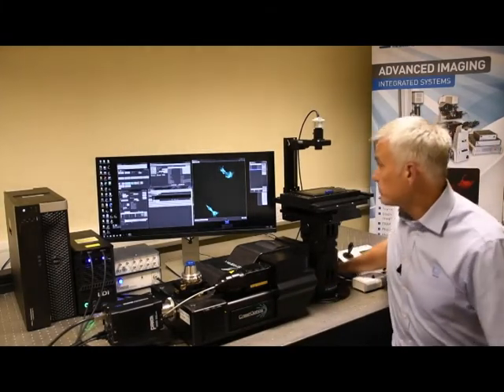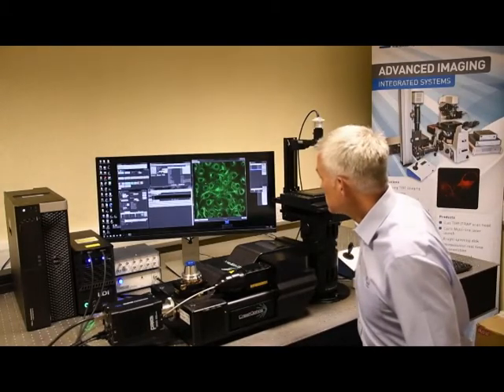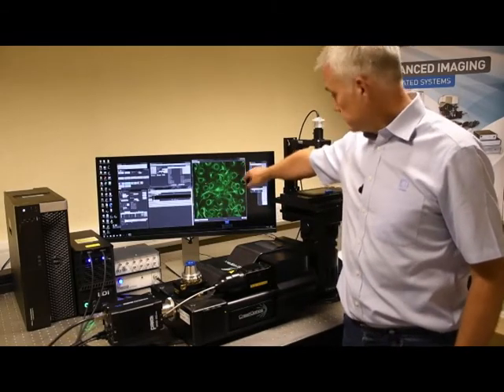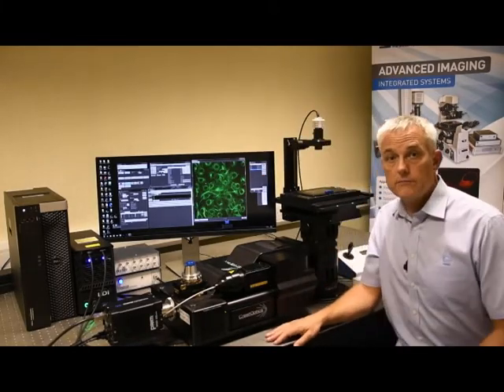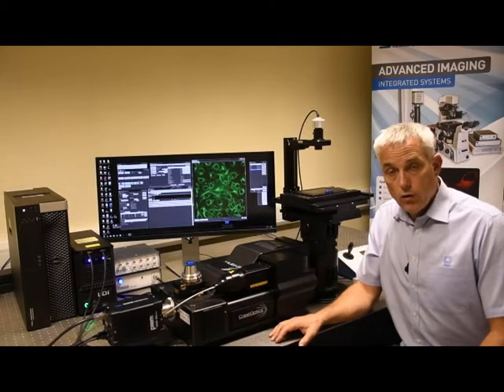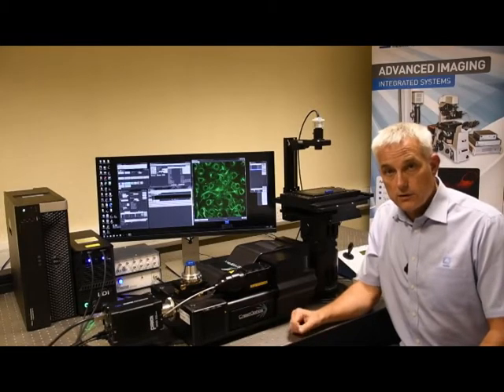To show that, I'll just move to a different location and go live. Refocusing slightly, you can see from the bottom corner to the top corner, on both diagonals, that there's no drop-off in intensity towards the edge. This is particularly important when you're image stitching, or if you have sparse samples where you want to have one or two cells at disparate locations in the field.